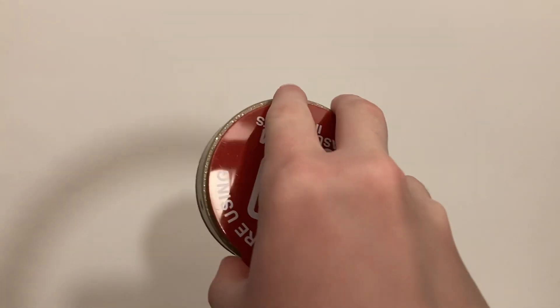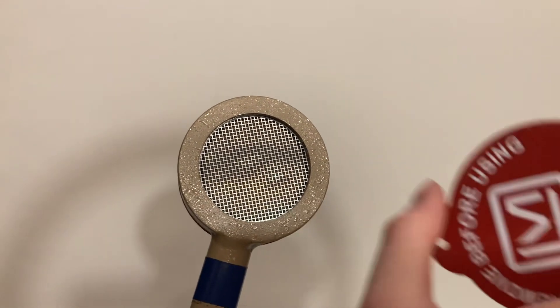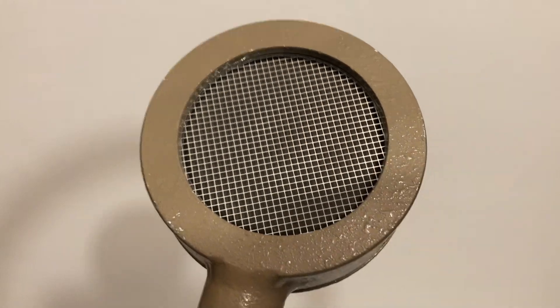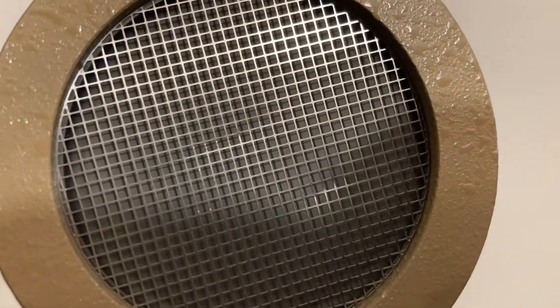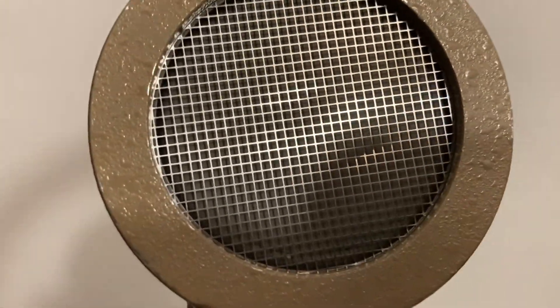Remove the snap-in front cover from the end of the 44-9 pancake detector. Inspect the window and make sure there is no damage to the thin layer of mica that allows the alpha particles to be detected.